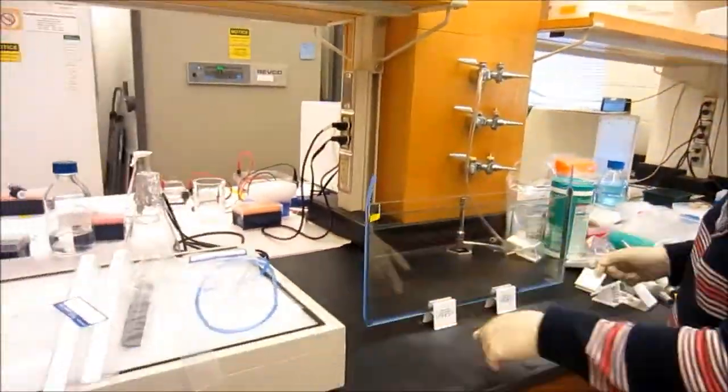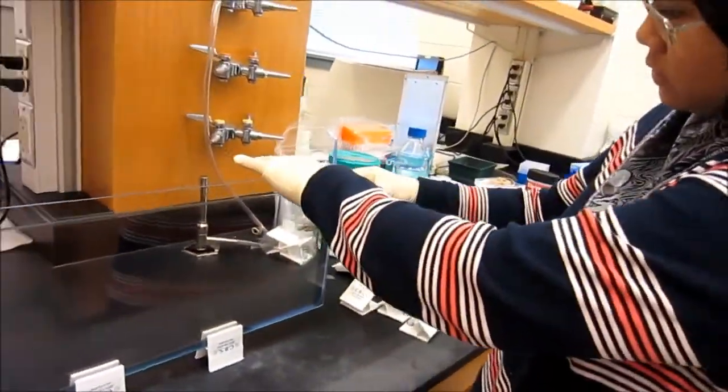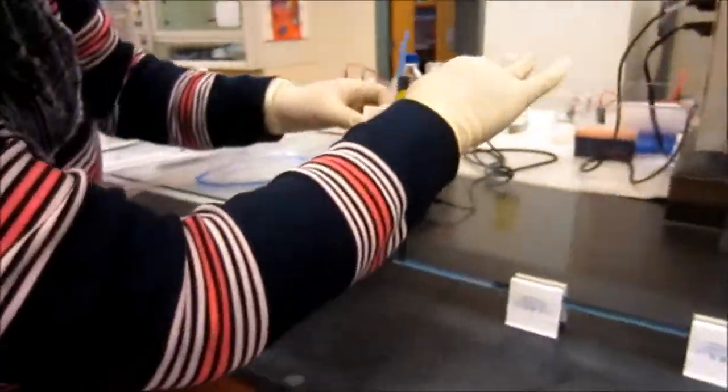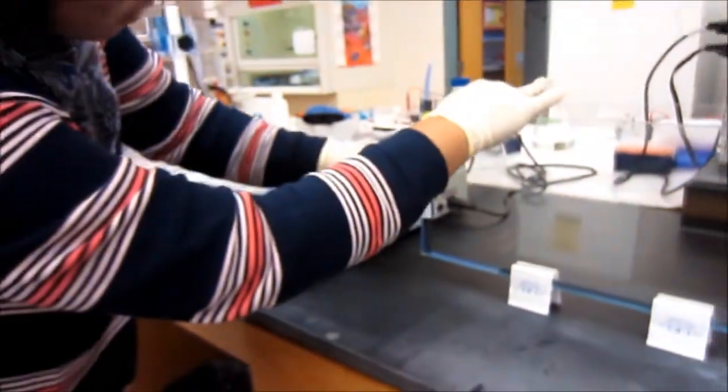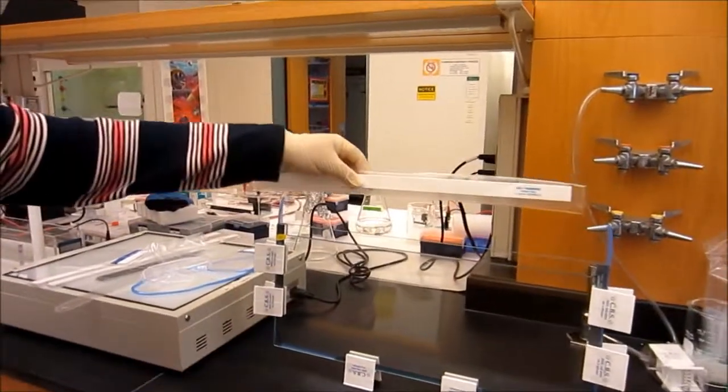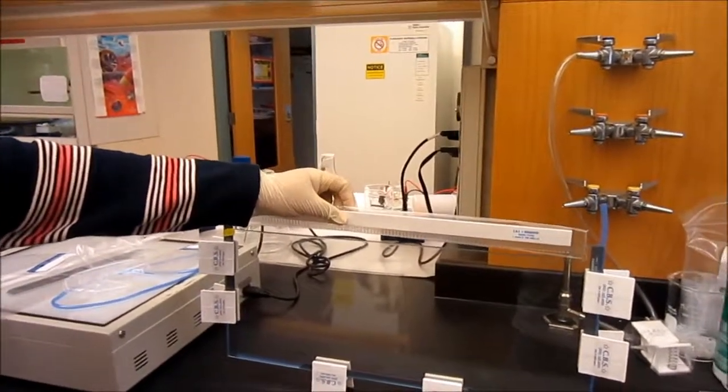Then, the glasses are made to stand and two more clamps are attached on each side. You can see that comb can be placed at the top of this assembly.